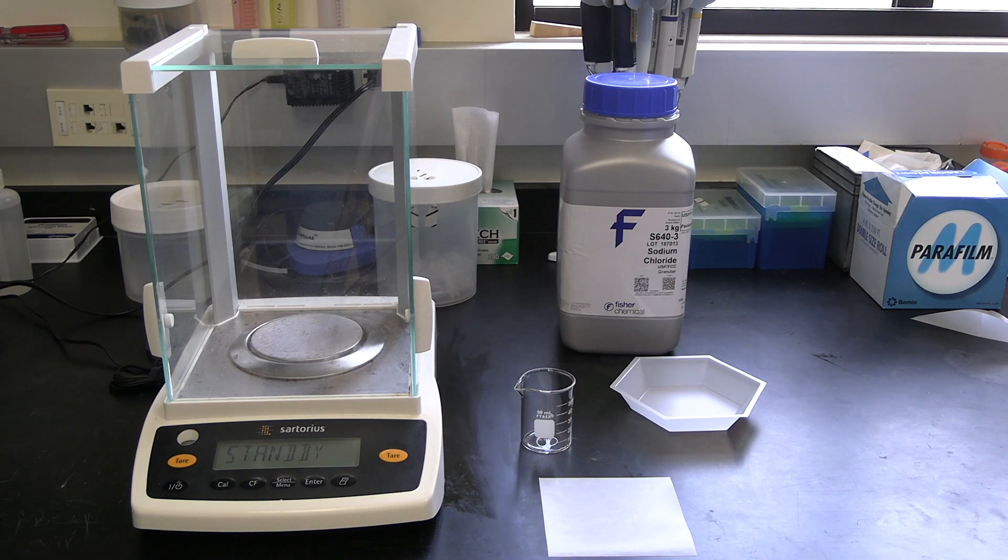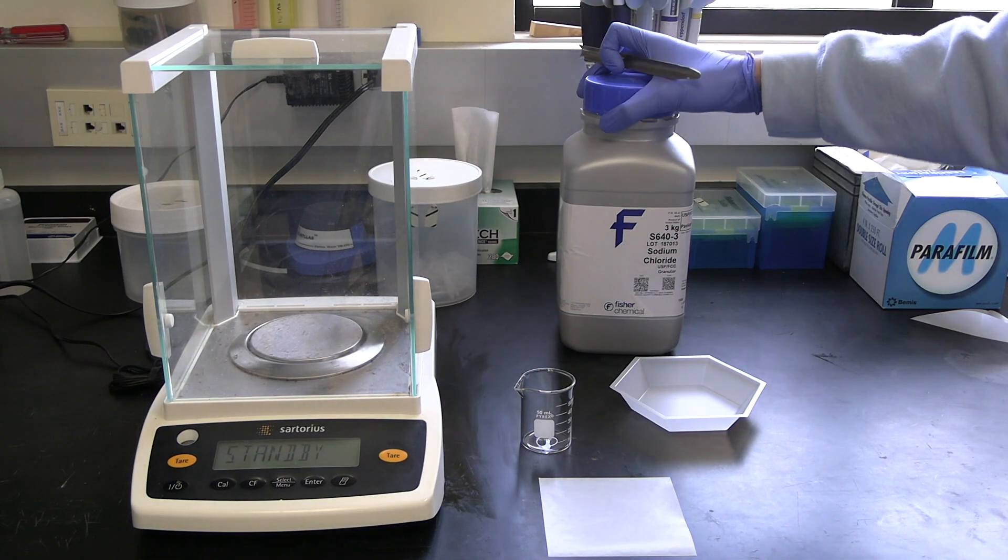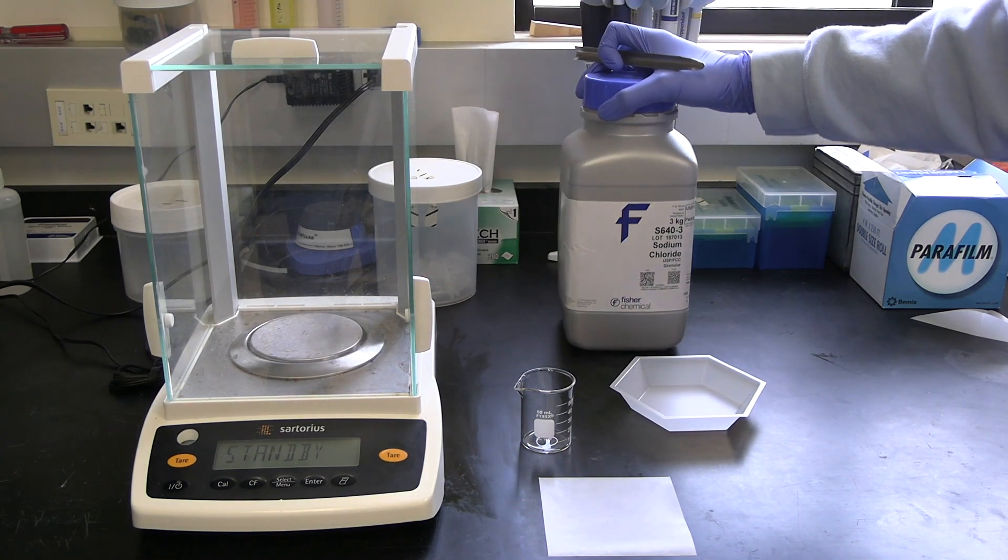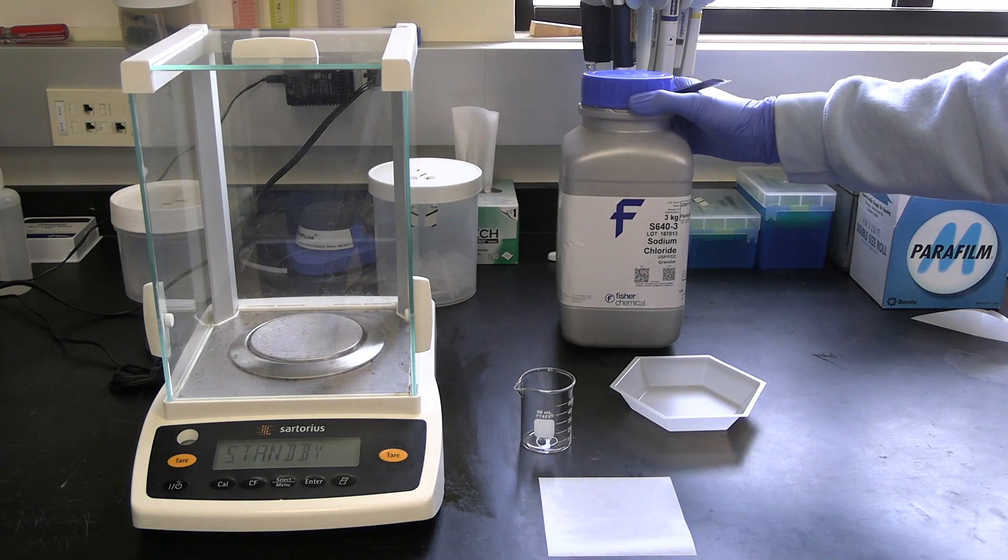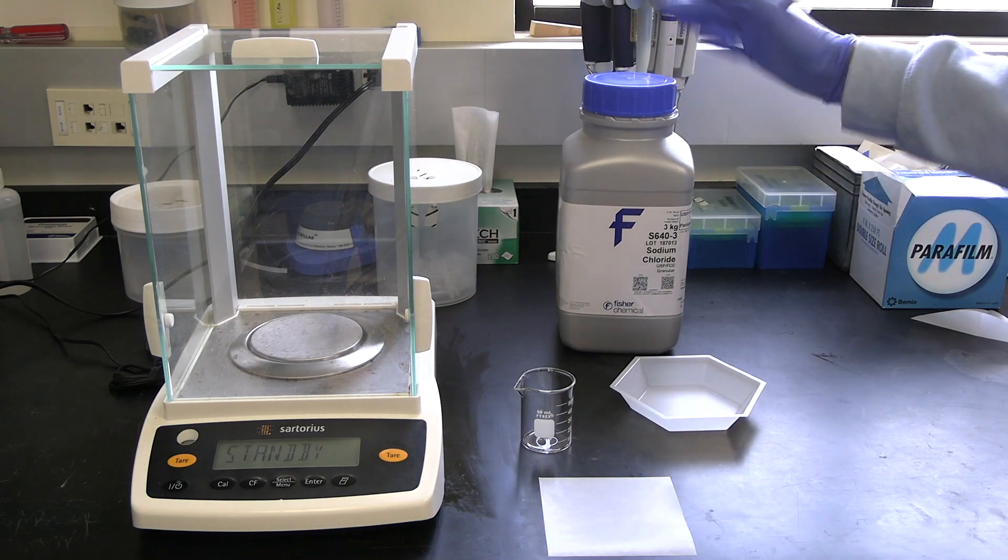All right, so this is going to be a video on weighing, and in particular, we're going to be weighing some solid, some sodium chloride, or table salt.